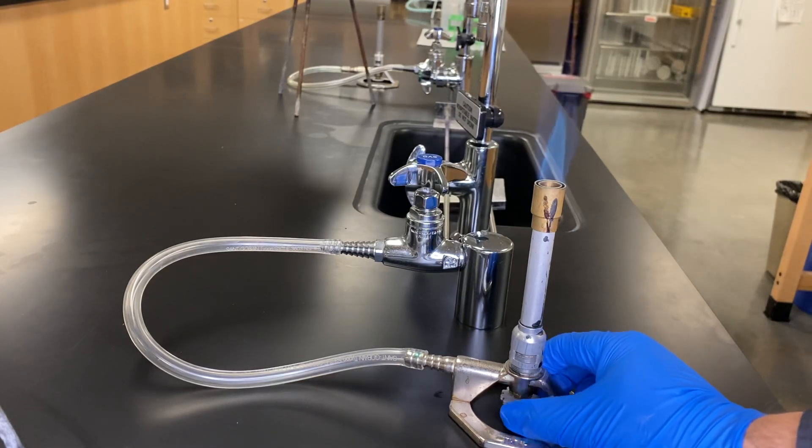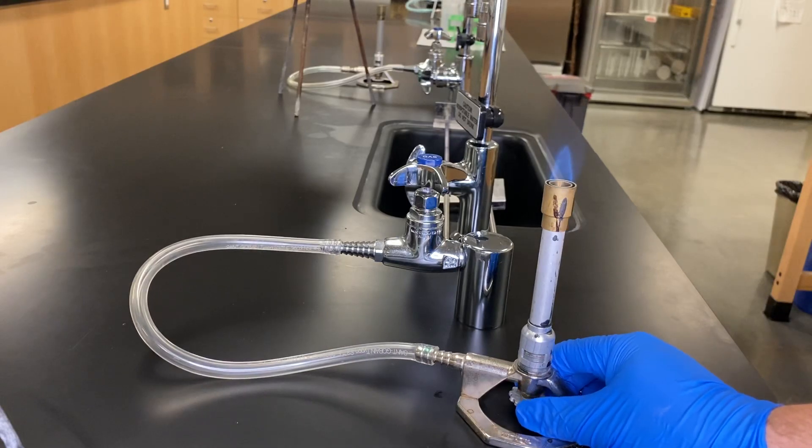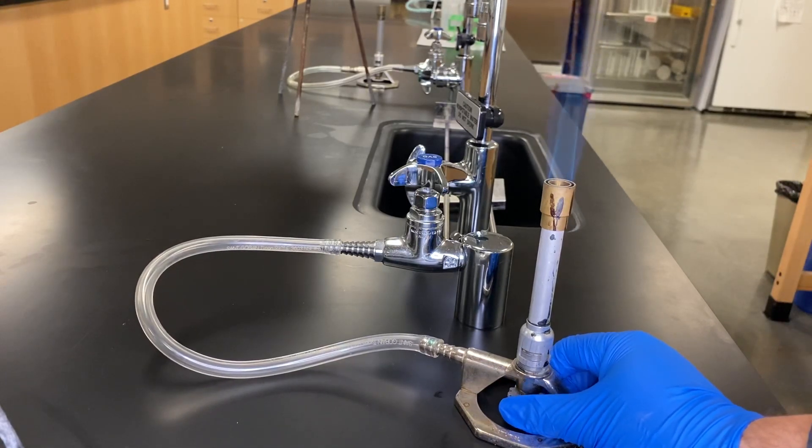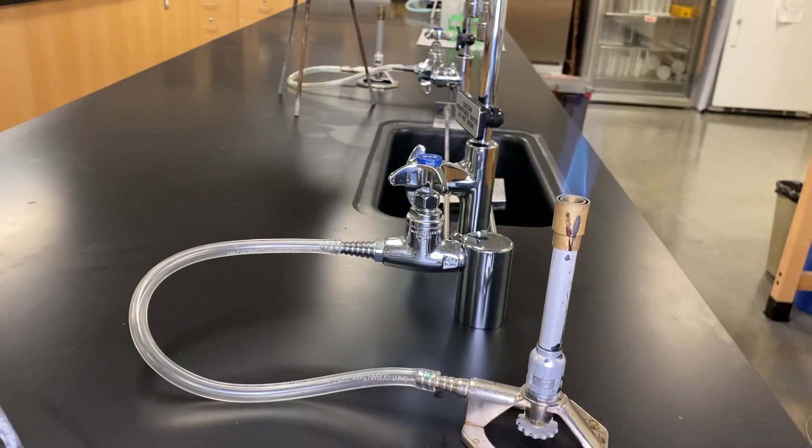And mind you, like I said back here, the valve that we won't really play with very much kind of closes the system. And so you'll see that it kind of makes it larger and smaller as we adjust it. So we really won't touch that guy pretty much. And it serves the same function as the main gas valve.